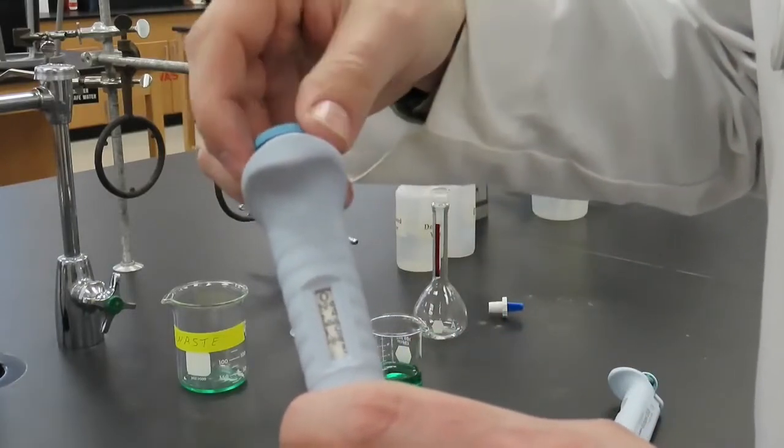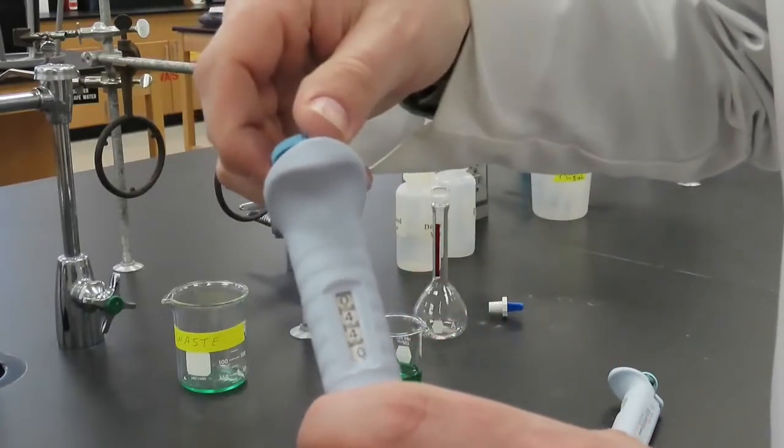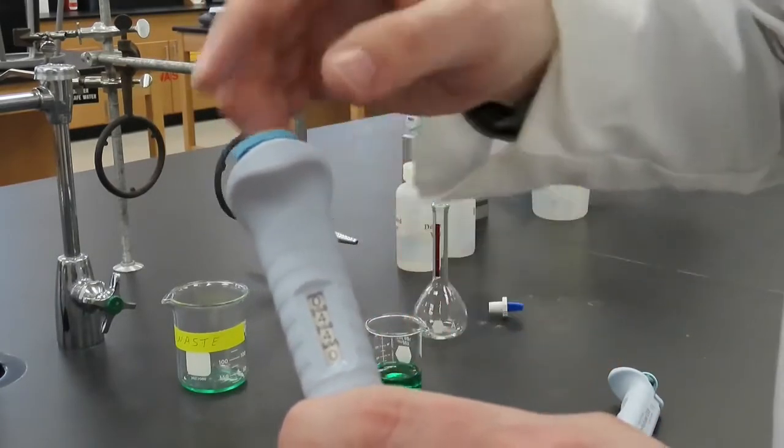Now it is set at 500 microliters. Now it is set at 440 microliters.